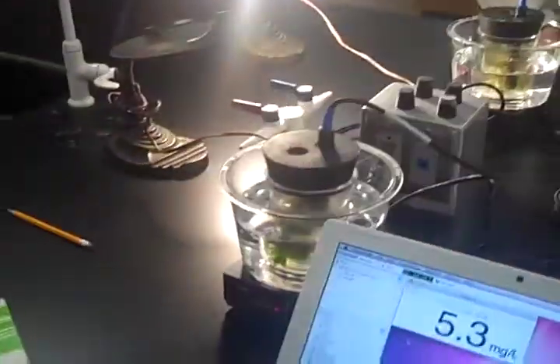I know a lot of you might be thinking you know a little something about photosynthesis. What we're about to do is a little project on what really happens in photosynthesis. Here we have a project set up. We got ourselves a computer, a GLX, some plants and some water, and a lamp. We're going to be using all four of these instruments to monitor what effects photosynthesis can have on the amount of oxygen within water.